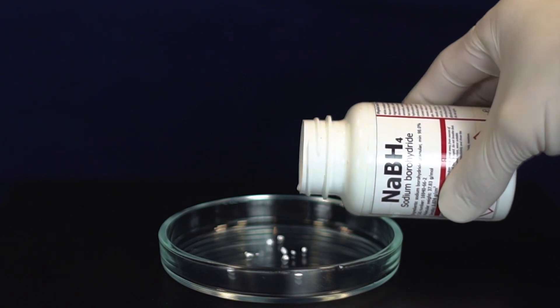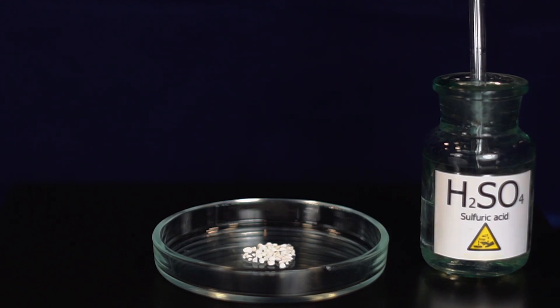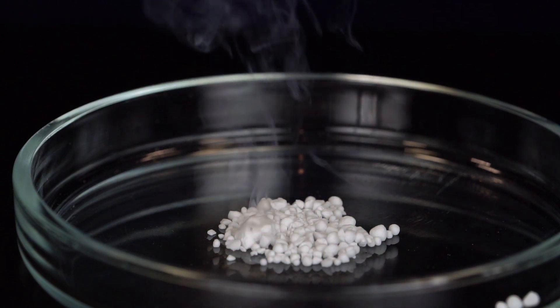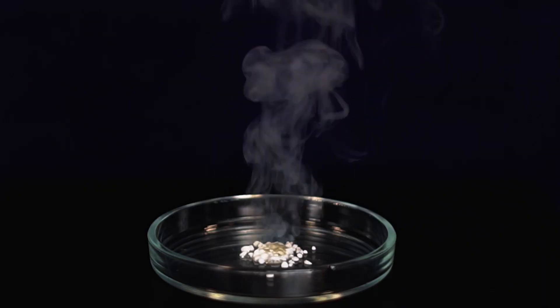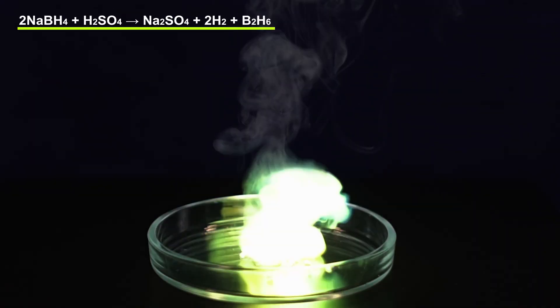Sodium borohydride can also be ignited with concentrated sulfuric acid. The first flare is green, it's the result of diborane's combustion on contact with air. Potassium borohydride is a lot more active in this reaction.